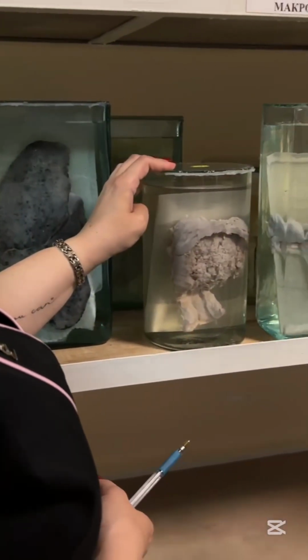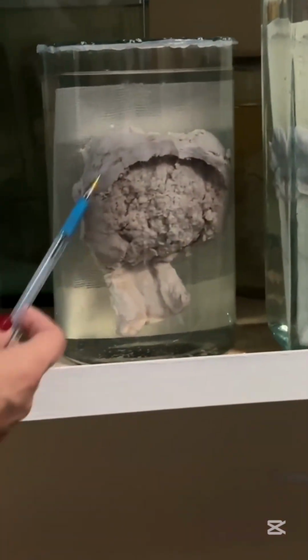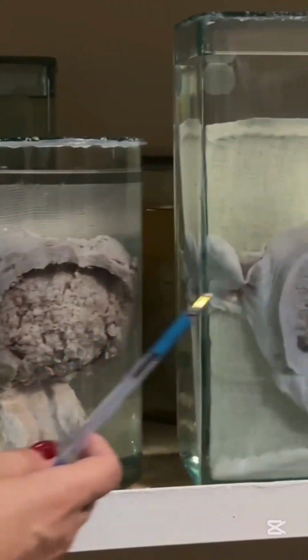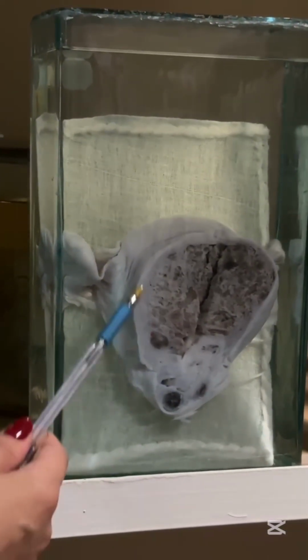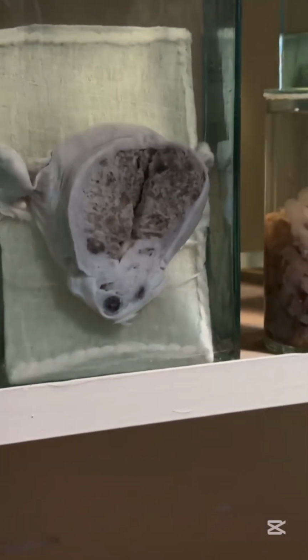That one was the previous class. Carcinoma of the uterus, adenocarcinoma, malignant tumor of endometrium. This one, chorion carcinoma, chorion epithelioma, a malignant tumor of chorionic villi. You should remember the specific structure of this tumor.